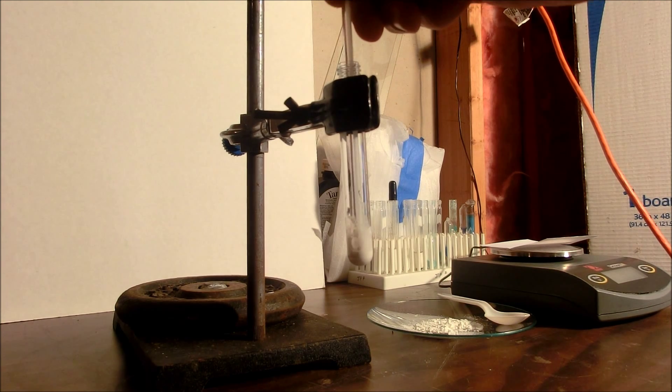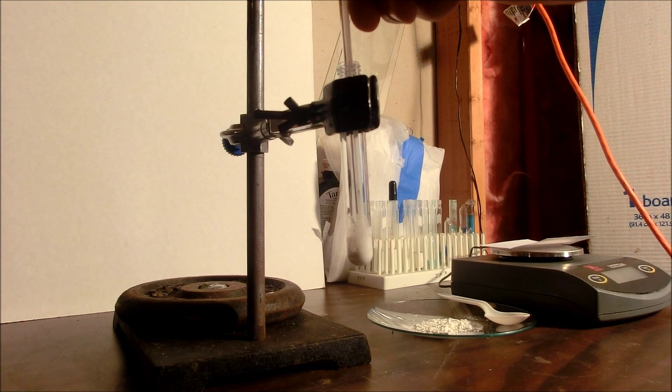So I'm just going to stir this up and then use a heat gun to boil away the solution or evaporate the solution.